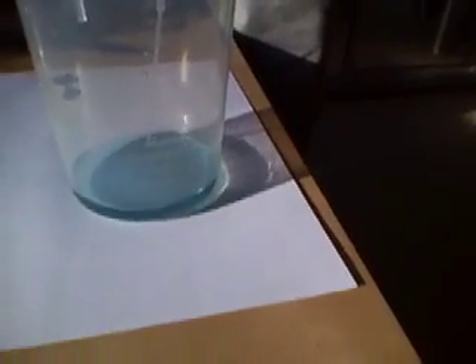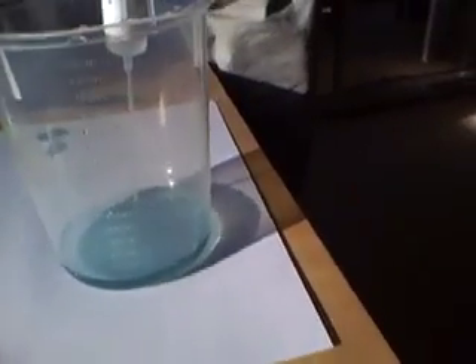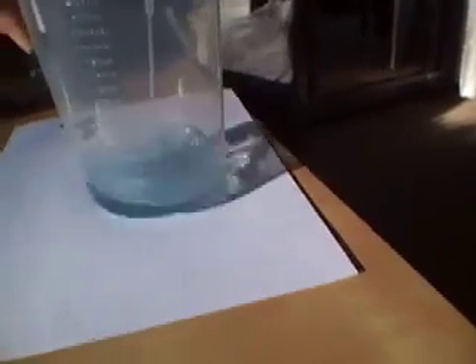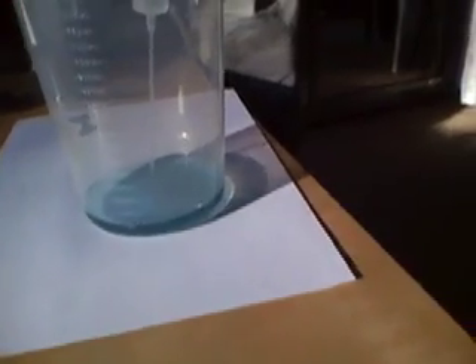A little bit more, and the colour you should go for is halfway between the green and the pink, which sometimes looks a grey colour. You need to do this in good light with a piece of white paper as a background, and the trick to getting consistent results is to always do this so that you get the same colour every time you do this titration.